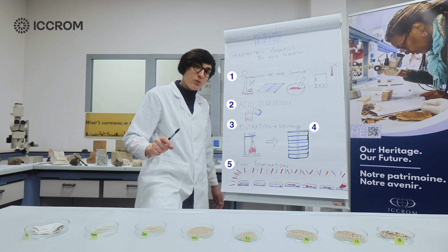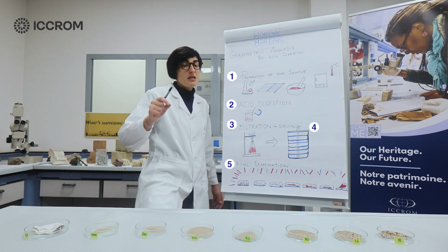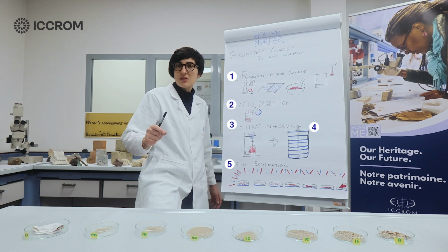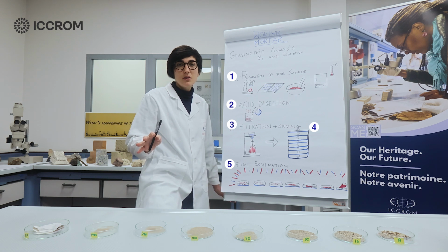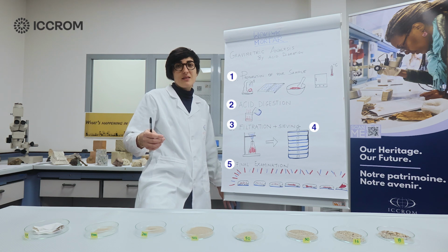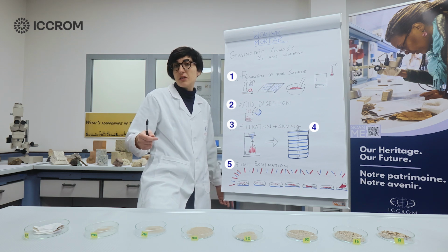But also remember to be very careful, because this test can be misleading sometimes, as certain parts of your sample might be dissolving during the acid digestion, which might lead you to misinterpretation. So, although a very good start, it is recommended that you accompany this test with other techniques. And indeed, remember to do a proper historical research and proper documentation of your building.